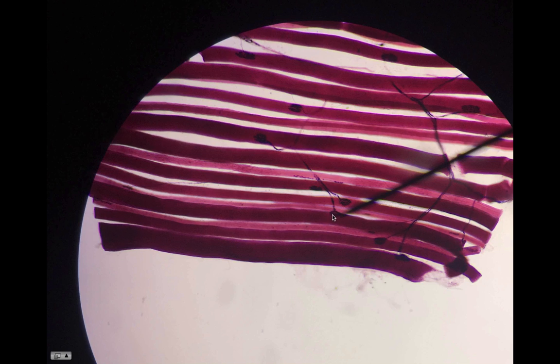And then this thing here, the pointer's kind of pointing at it. You see one here, here. Every muscle fiber is going to have its own neuromuscular junction where it comes together with the axon, right? So all these are the neuromuscular junctions. If you want to call it a motor end plate, I don't care. You can call it a motor end plate. Just know the difference between a true motor end plate and the neuromuscular junction.